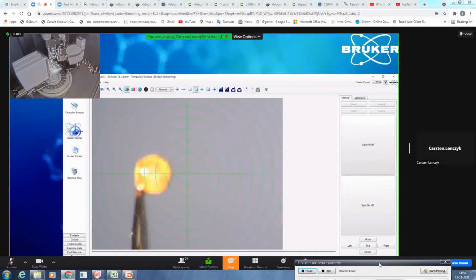So as Pratap already said, we already mounted a crystal successfully on the loop and put this loop on the goniometer. And we have two kinds of different goniometer heads. As you can see here, we now have the manual one, and I show it in the camera. You have some different screws, so you can center and align it by using a special screwdriver, which I will show in a few seconds, by just turning those screws.